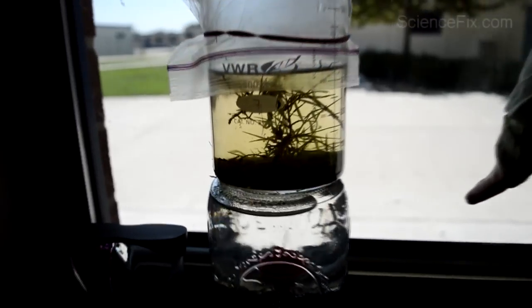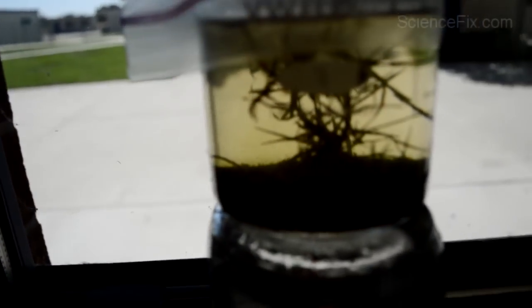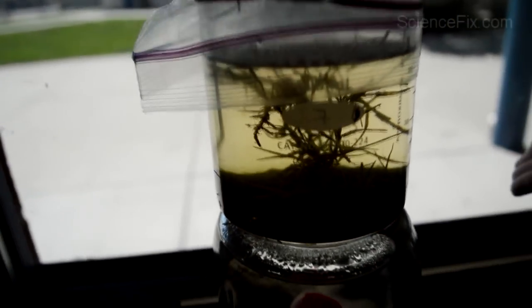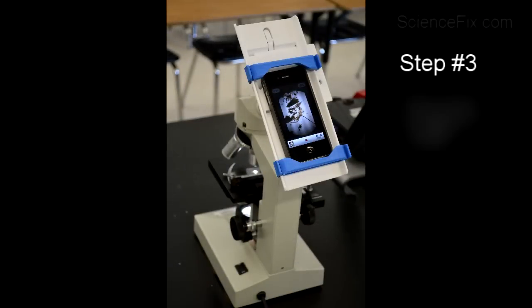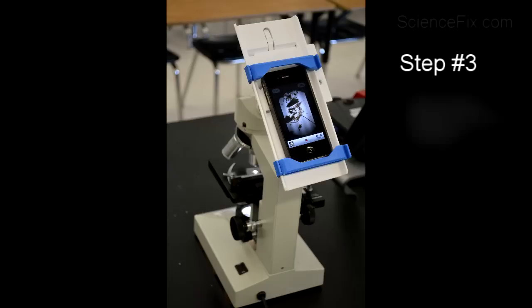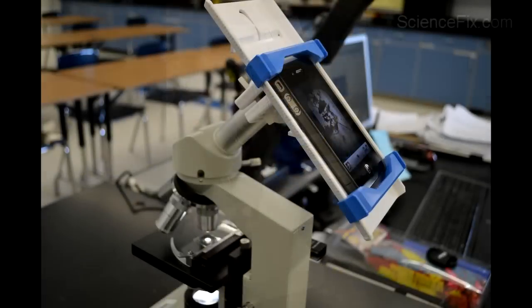You're going to want to let it sit for a couple of days. After a couple days, go ahead and put a drop of water — you usually get the drop of water from one of the pieces of grass or dirt — and just put it on a slide and put it underneath the microscope.